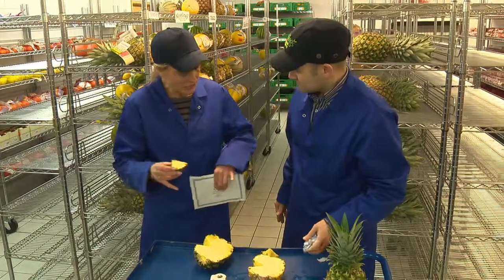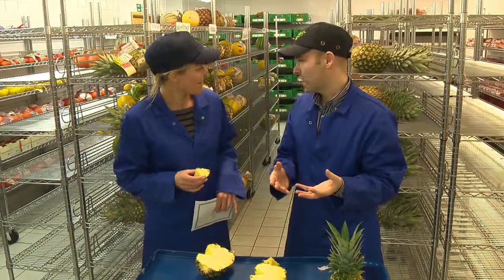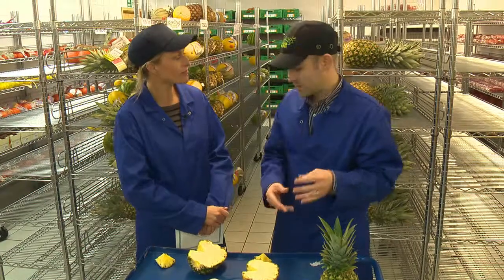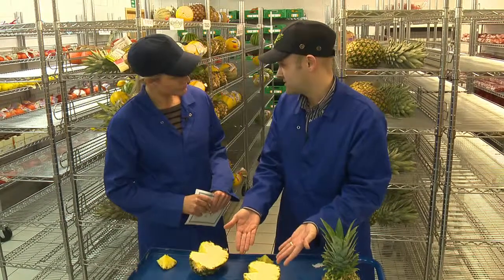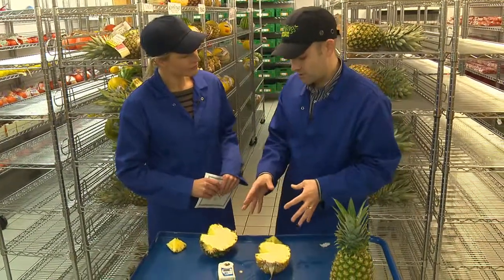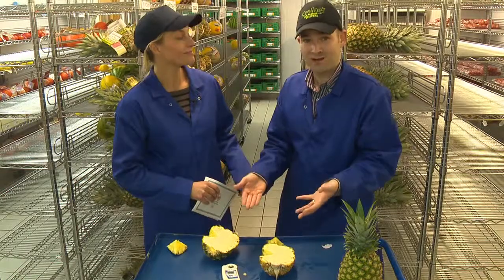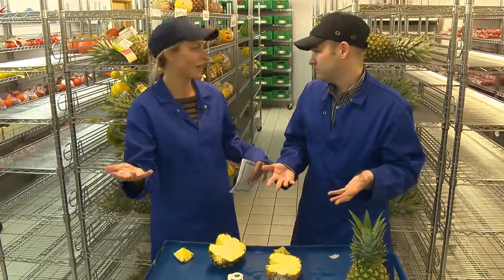So you do that for a pineapple in every batch just to make sure that it's sweet. In the shipping container you'll have 21 pallets of pineapples. We have to test every pallet and take some samples from each one. Obviously we can't test every pineapple because as you can see it's destructive testing. We take a few samples from every pallet and if the sugars are okay then potentially it's a batch we can use for supply to stores. This should just be double-checking as well because at source they're doing the same tests — checking the Brix readings there. So it's very unlikely you're going to have one that isn't sweet enough.